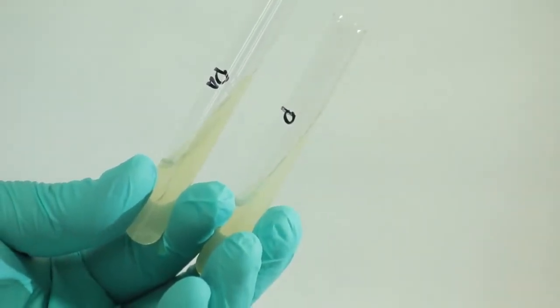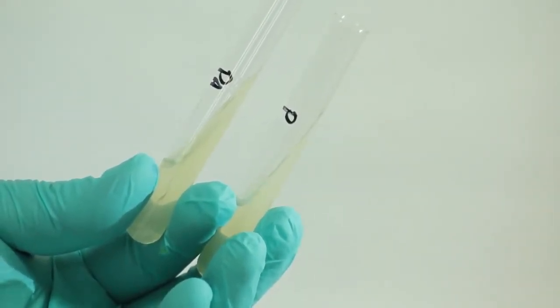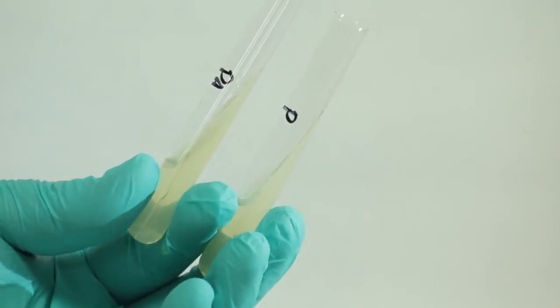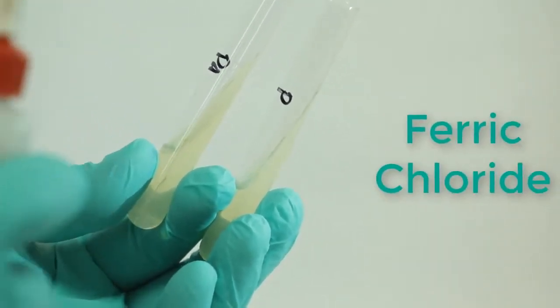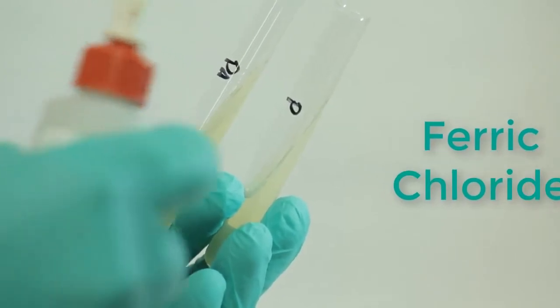Phenylalanine is a test that requires a reagent in order to force a reaction. For phenylalanine we will be using iron three chloride, also known as ferric chloride.